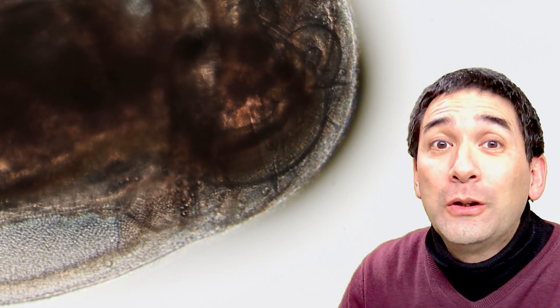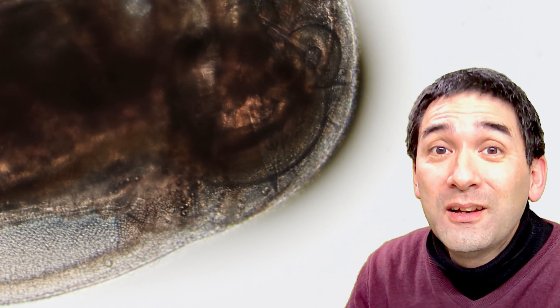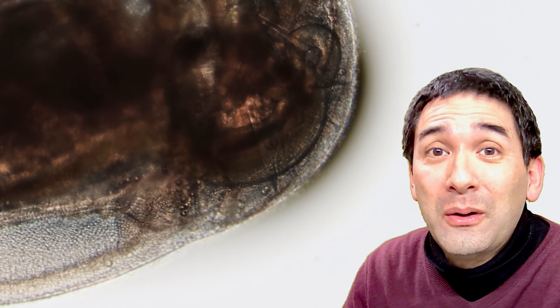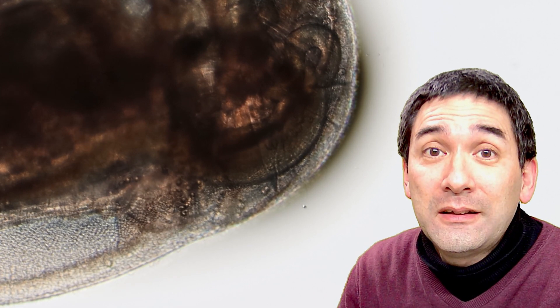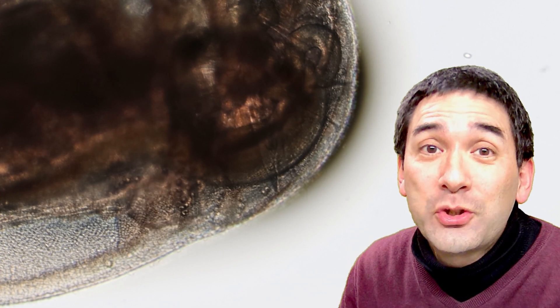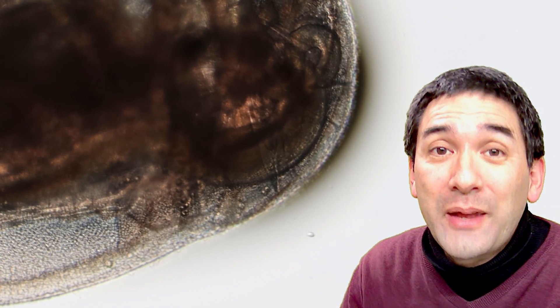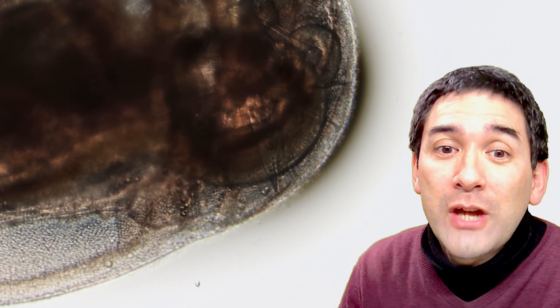Okay, so the alcohol does have a remarkable influence on the heartbeat of this little water flea here. And of course later on I would like to reverse it again, and of course if you add too much alcohol you end up killing the Daphnia. Something of course I did not want to do because I wanted to observe its change in behavior.